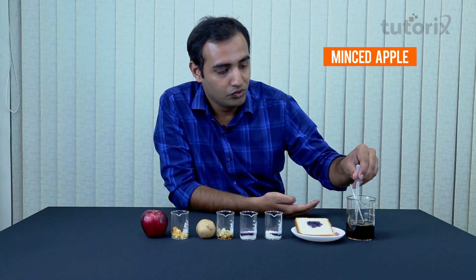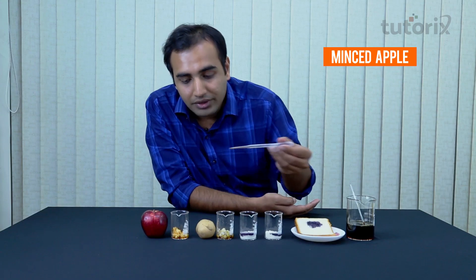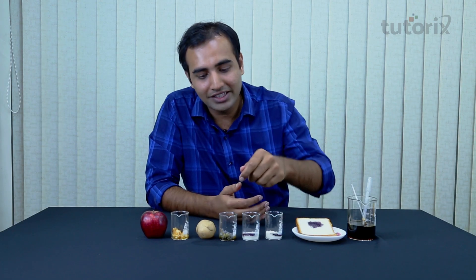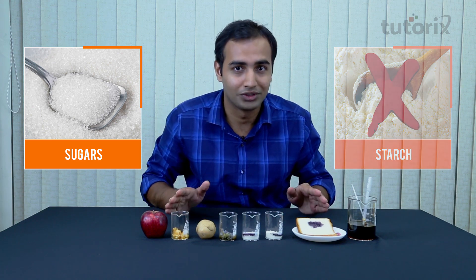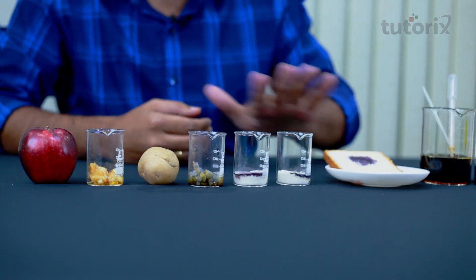Now we move on to the last food item, the minced apple, and you can see it is not showing any change of color. So let's leave our potato and apple samples for some time. After waiting, you can see that the potato has started to give a bluish-black tinge, but there is no such color change in apple. Why is that? Because apple does not contain starch — it contains sugars in high amounts. This test is only for starch and will not tell us anything about sugars. So apple is not giving a positive starch test, whereas all the other ingredients have given a positive starch test.